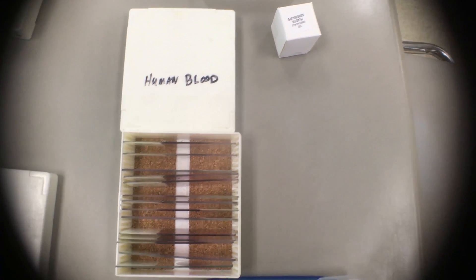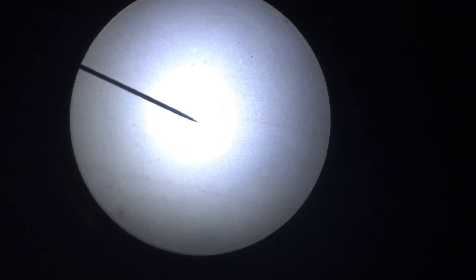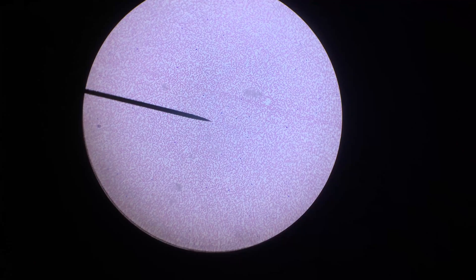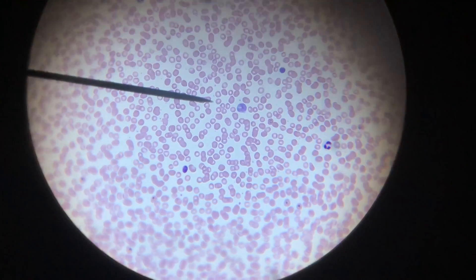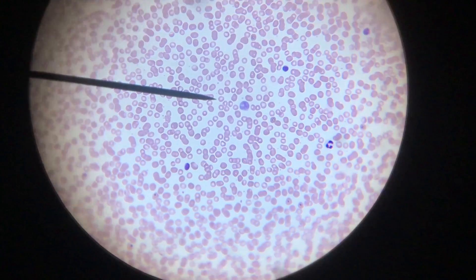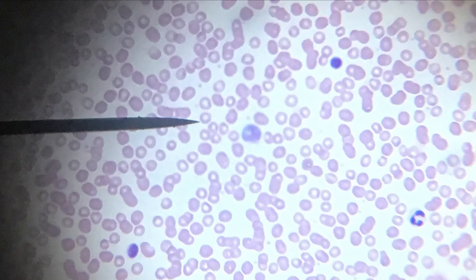Finally, we'll be looking at human blood. This will not be a sample that you will need to draw a diagram of, or that should be included in your analysis. This is scanning power. This is low power — you can start to see individual red blood cells, as well as small purple dots that represent different types of white blood cells. This is high power. The red blood cells are clearly visible; they look like little donuts. The white blood cells are also quite visible as a kind of purple, misshapen cells.